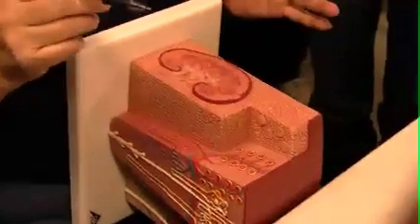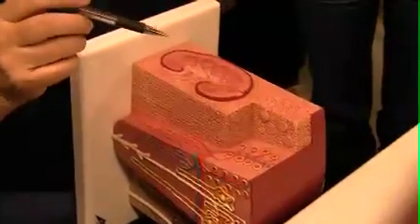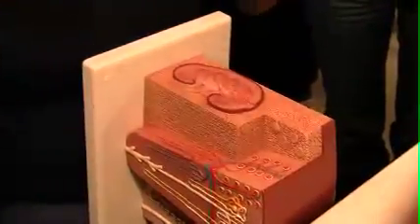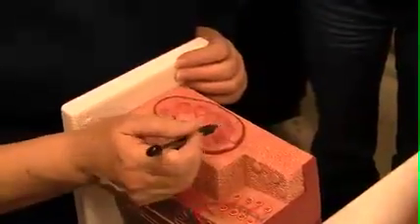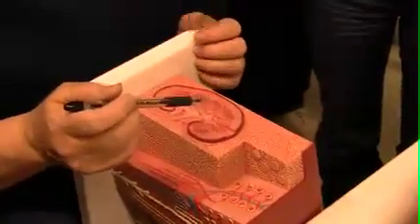And remember, they look a lot like islets of Langerhans, so make sure you look. But you'll see a lot more of these, Bowman's capsule and glomeruli, in the kidney slide than you will islets of Langerhans, because islets of Langerhans are not very common, they're only 1%. Okay, and then you have these varying lengths of nephron loop, or also called the loop of Henle.